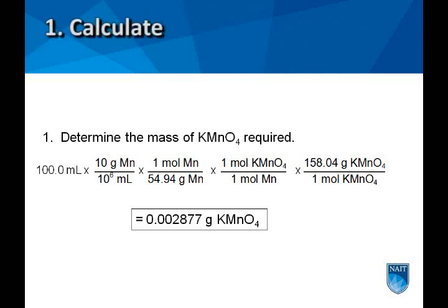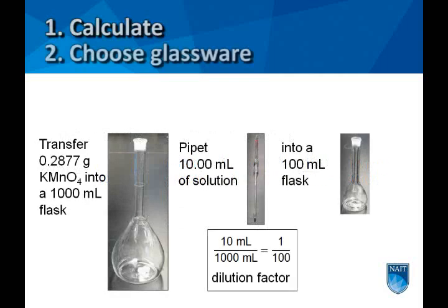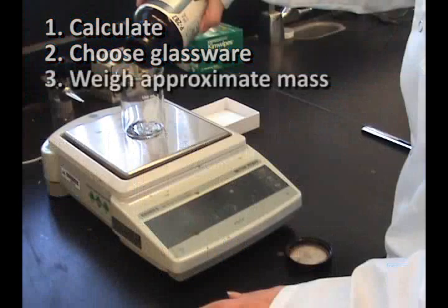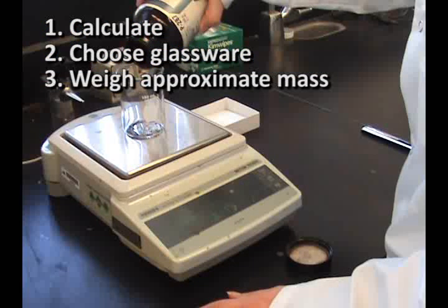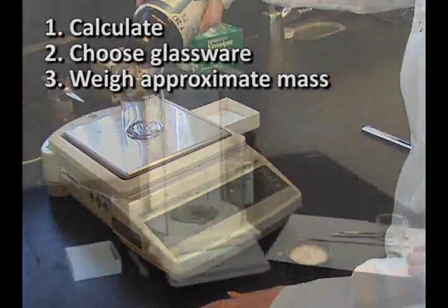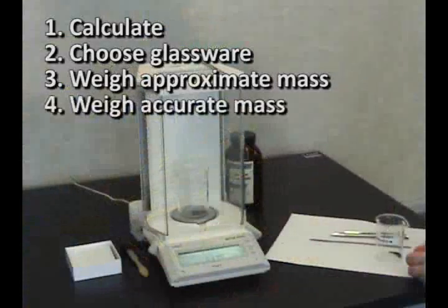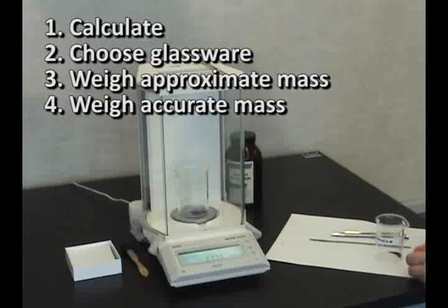Calculate the mass needed for your solution. Decide what glassware is to be used. Weigh out on top-loading balance the approximate mass. Weigh accurately on analytical balance.